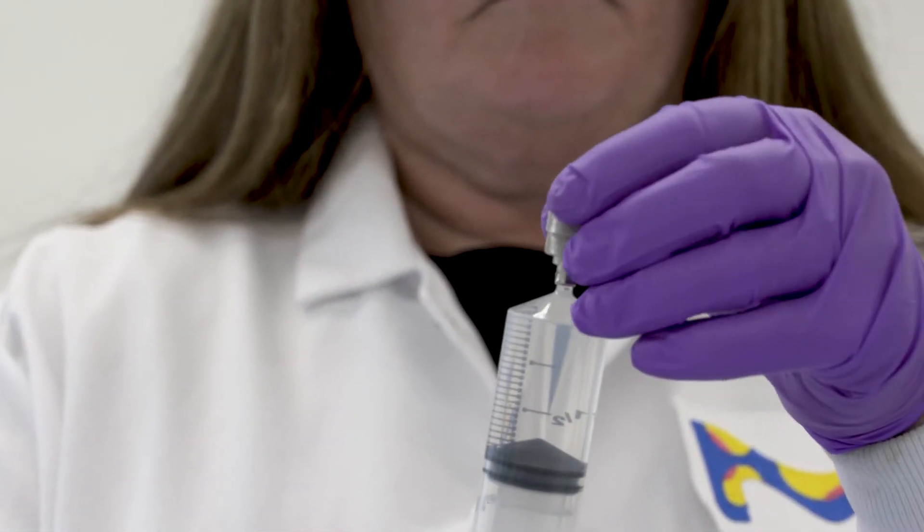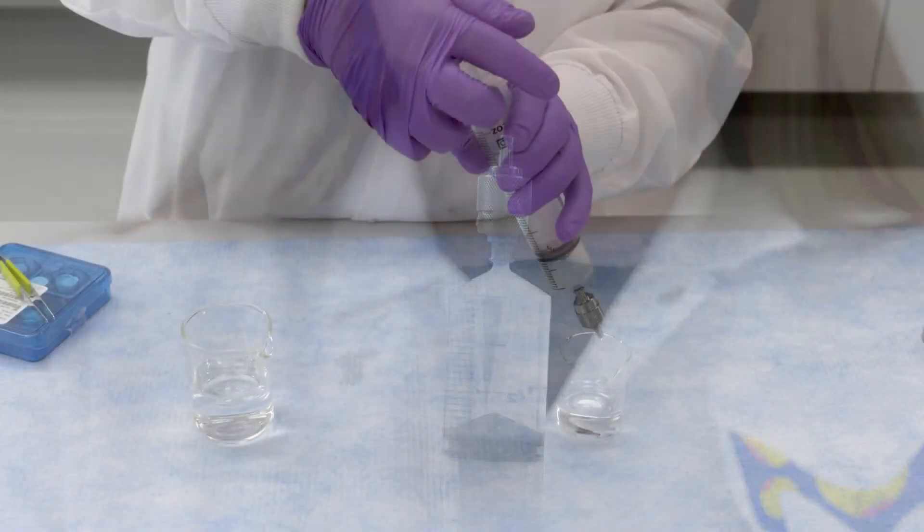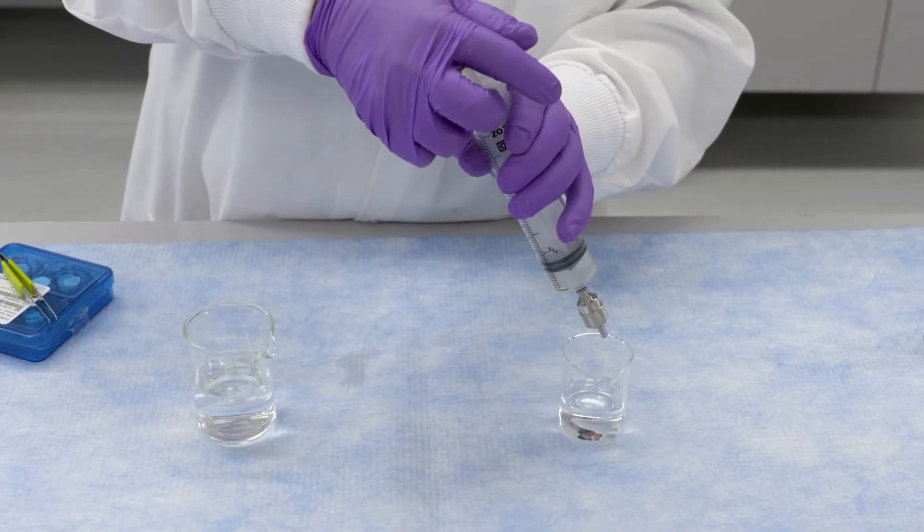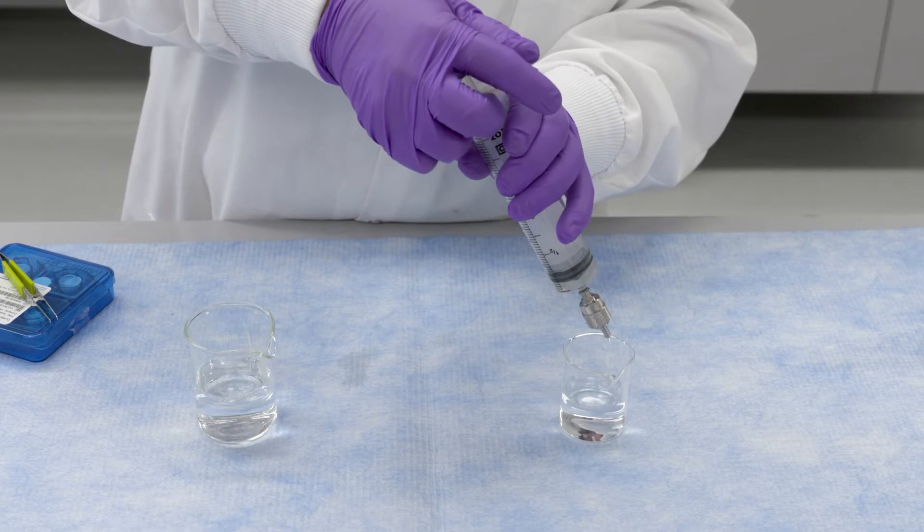Made of stainless steel, the syringe-operated filter holder is designed to sterilize or clarify small volumes of liquids by pressure filtration up to 100 psi.